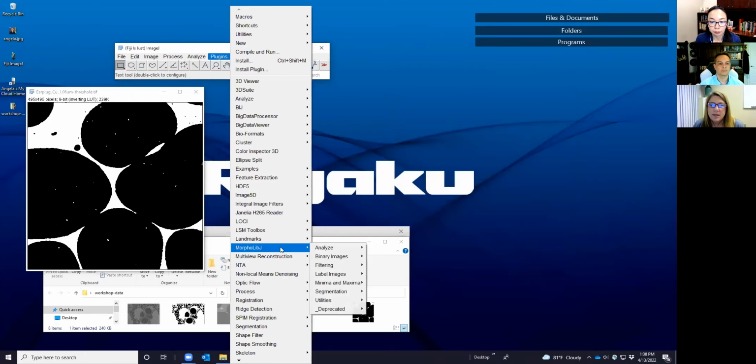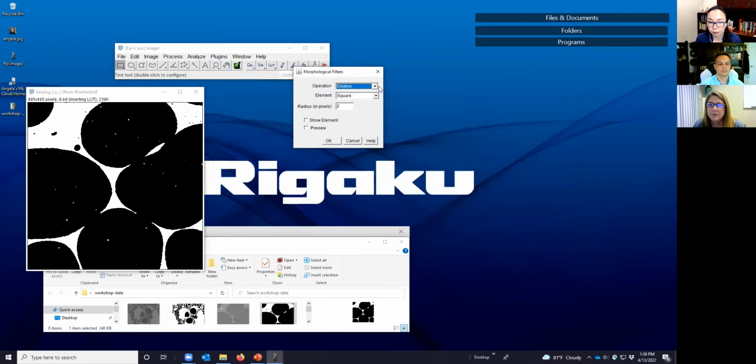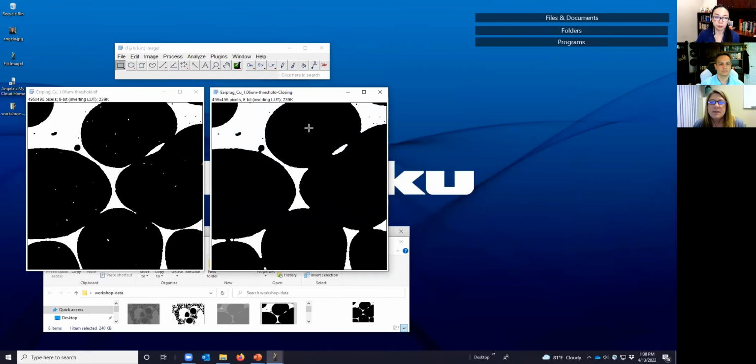So we go to plugins and filtering, morphological filters, and let's look at closing first. With our disc-shaped element, we'll change it to 3 so we can see a dramatic effect and say, okay. So in this case, we're still left with our false positives, but the holes are gone.